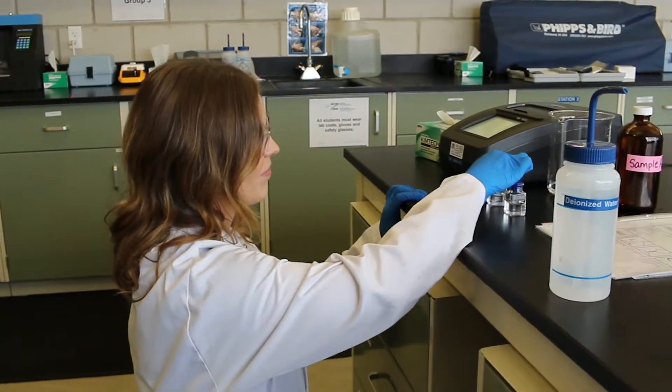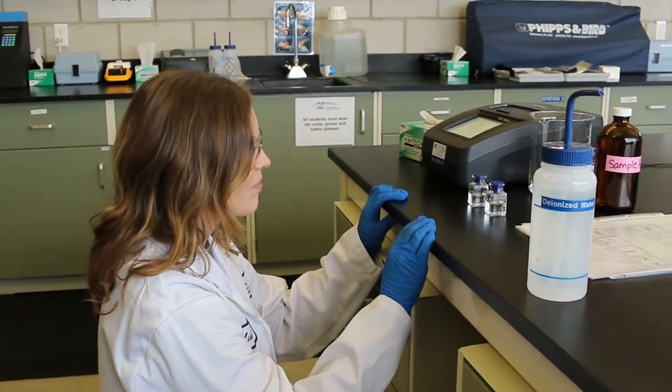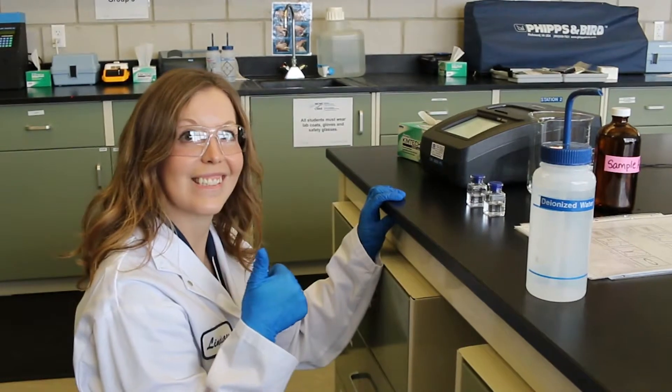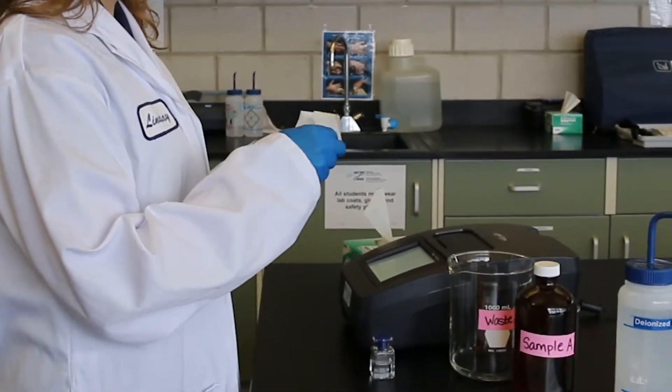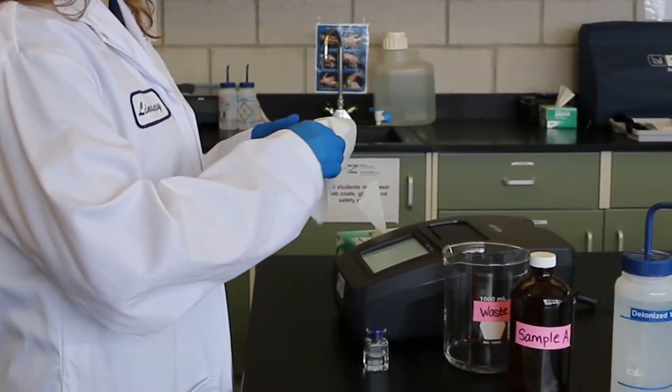Prepare the sample cell by rinsing and filling the sample cell to the level indicated with the sample water. Again, ensure the outside of the cell is fully cleaned, dried and relatively scratch-free.